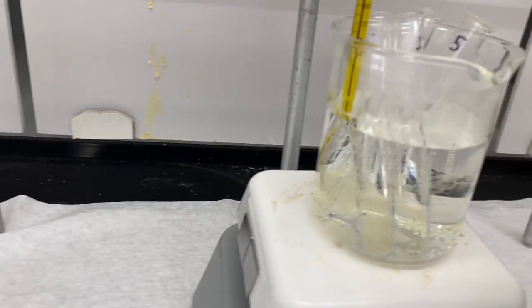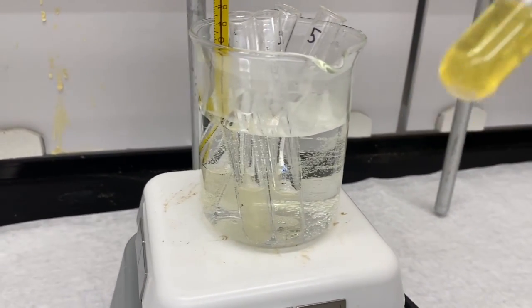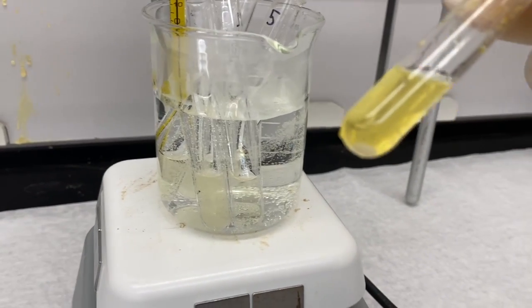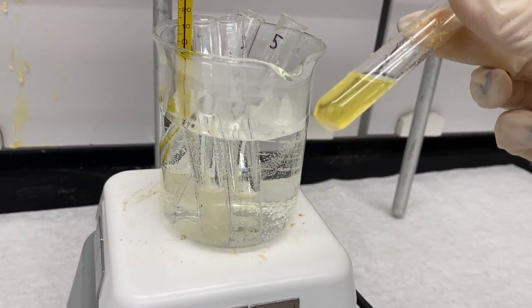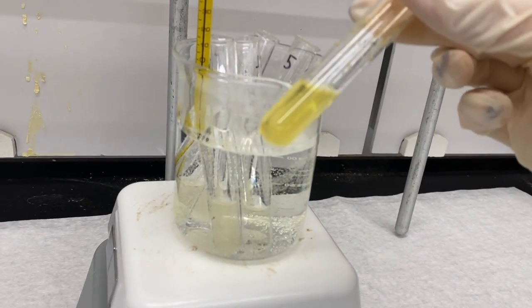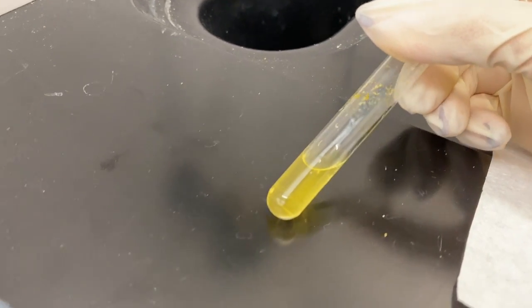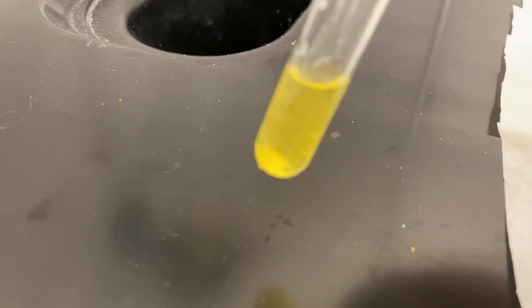So this is number 6. This is our tertiary bromide. And we do see, try and get a better view here. We do see a little bit of solid forming at the bottom. Put it over here. So that white solid there. And it's just a little bit, and we also see that our reactions just kind of turn yellow. But we see it there. So there's a little bit of solid there.